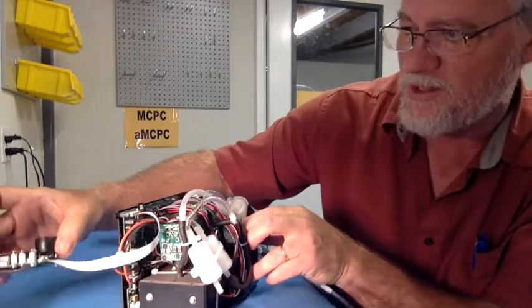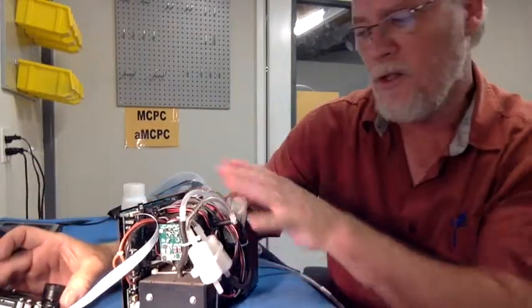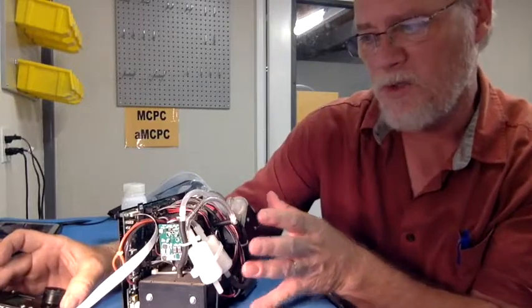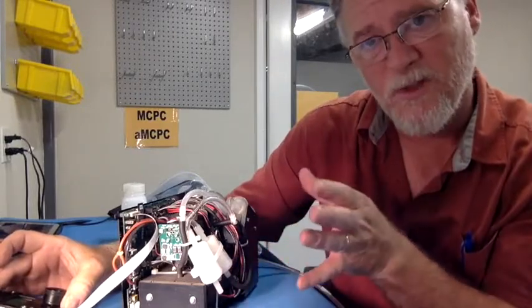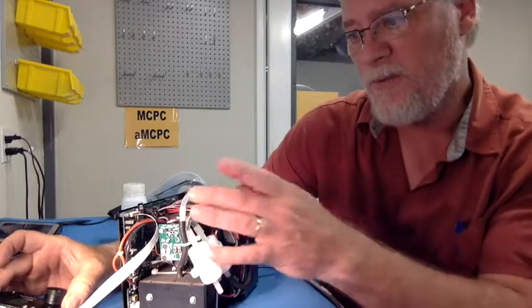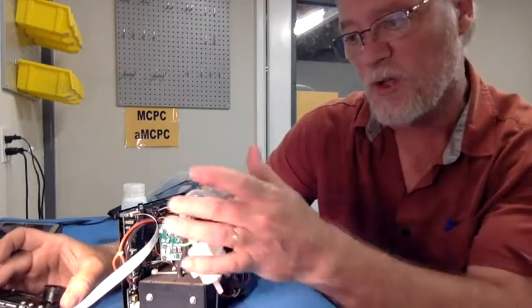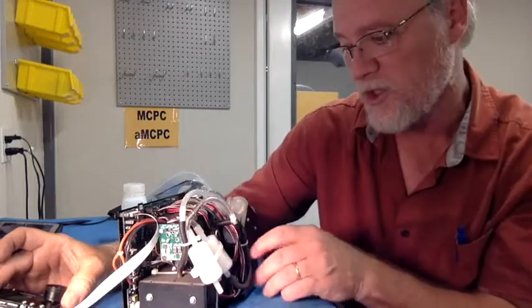You can see that this is somewhat of an OEM design. No covers. That's to keep the unit as small and compact as possible, but it also means that users need to beware these boards are exposed and are sensitive to static shock. Do not touch the boards during operation.